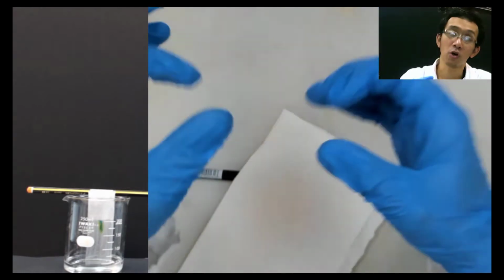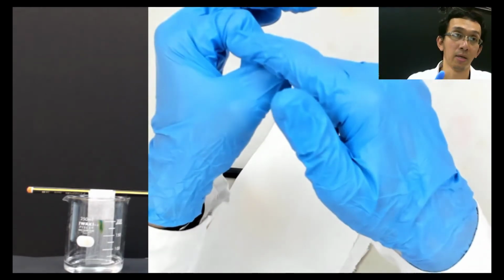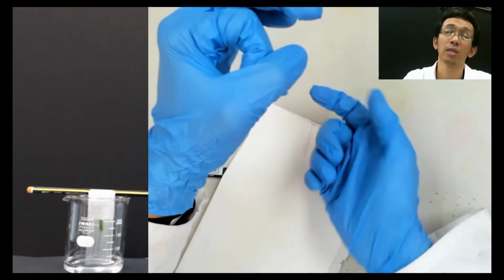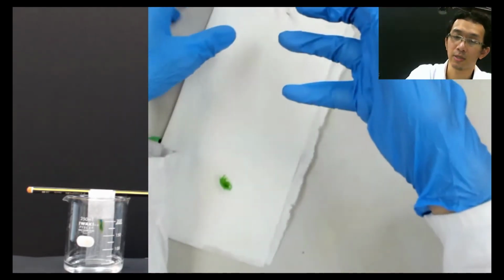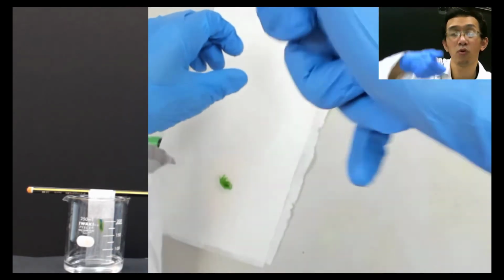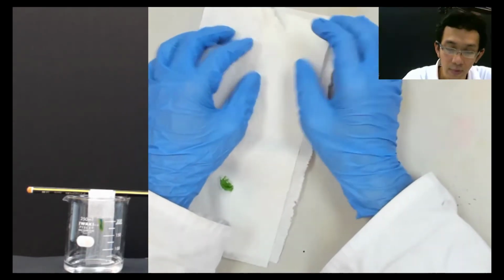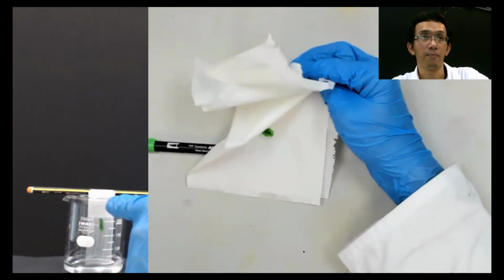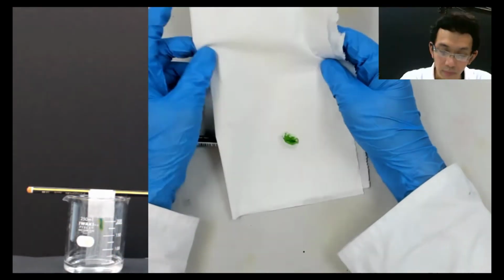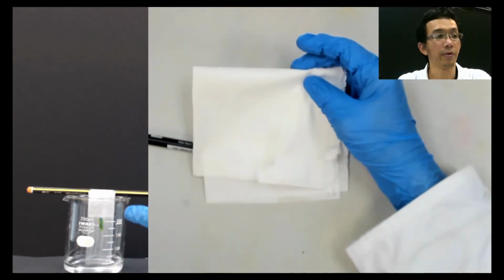You cannot do that using a normal straw, because normally the diameter is too big. When you put it on the water surface, the water will not go up. But this so-called small straw is capable of pulling the water up due to capillary action. So the keyword here is capillary action. Okay, I will let whatever happened here stay there, and later on we will discuss this.